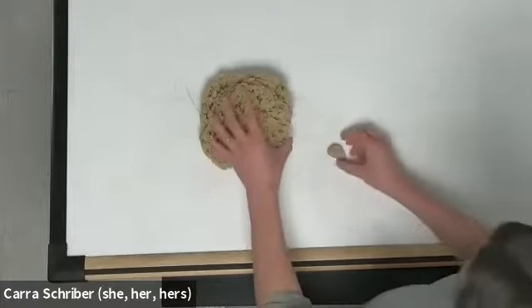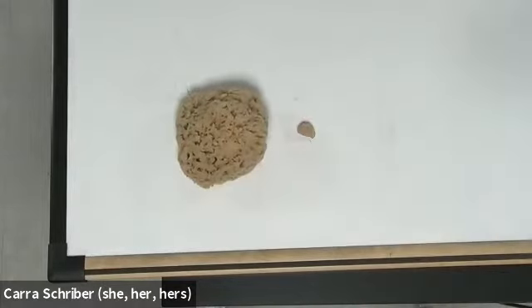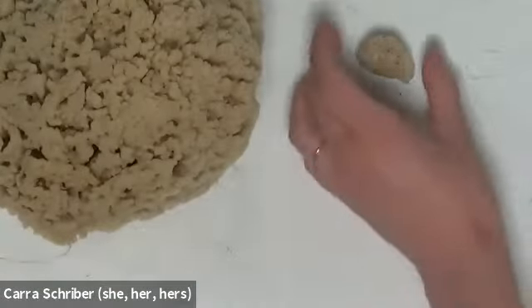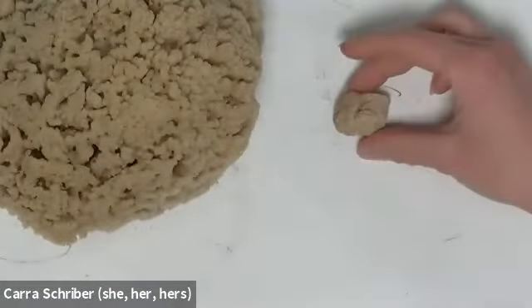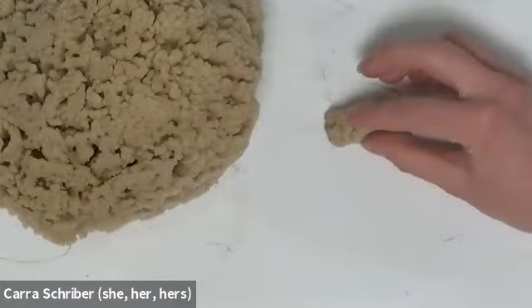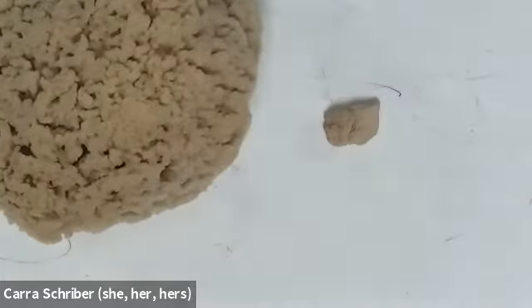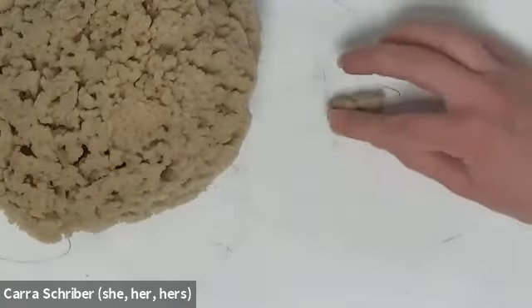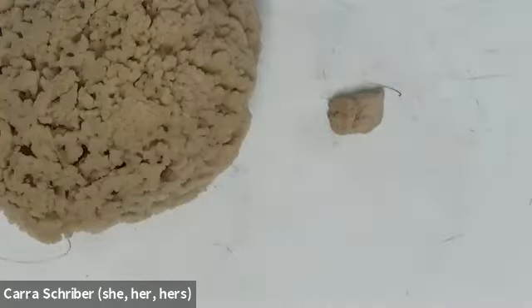And I also have a little piece of the calcareous sponges. If we look at this sponge, and I'm going to try and zoom in here a little bit, you can see that it's really not very visually interesting, let's be honest here. But it's much harder than this commercial sponge. That's because as a dried sample, it's mostly just calcium carbonate, okay? So that's that type of sponge.